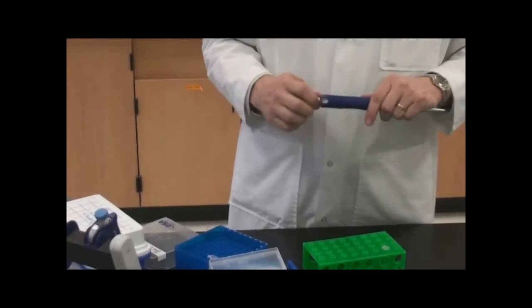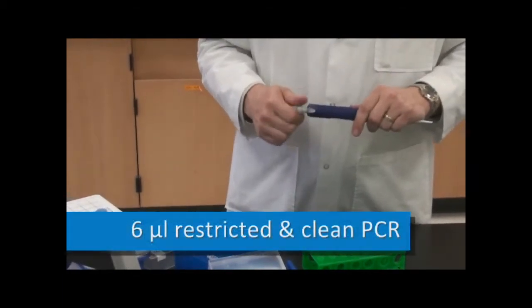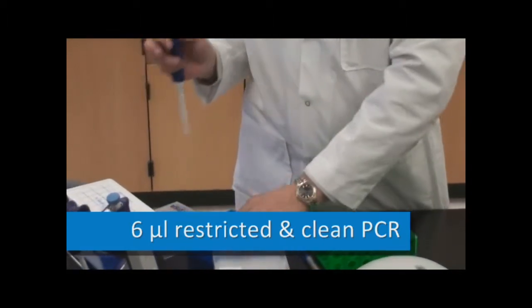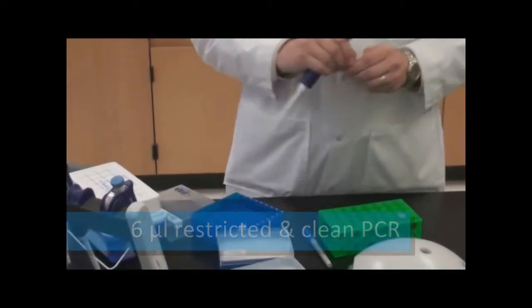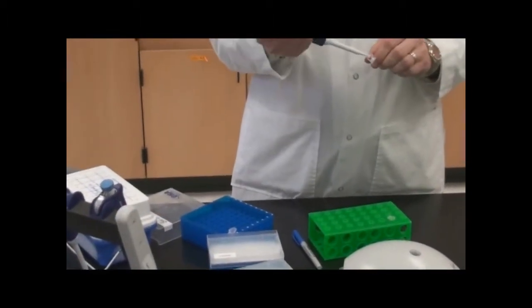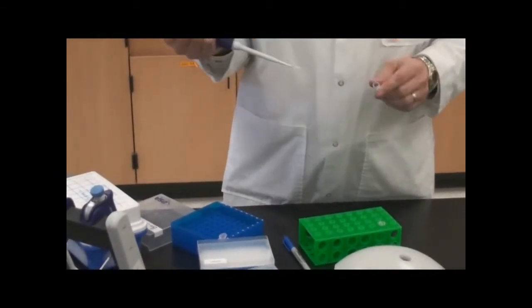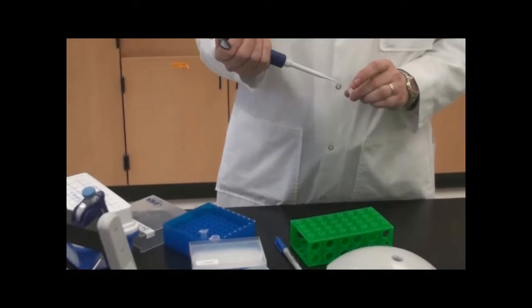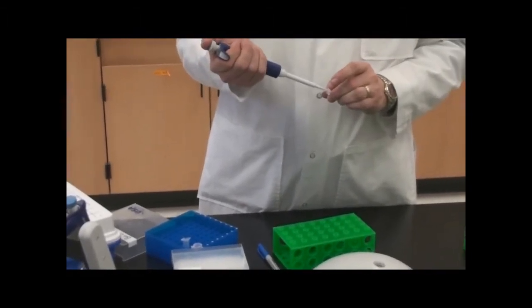And now I need six microliters of PCR that's been restricted and cleaned, and so I'm going to pull that up, pull out six microliters, and insert that in there.